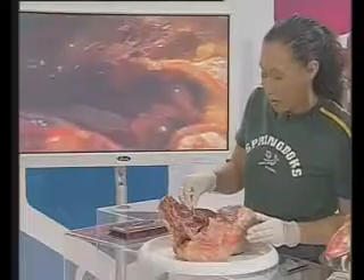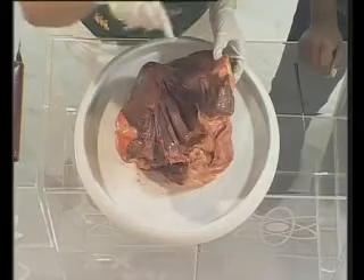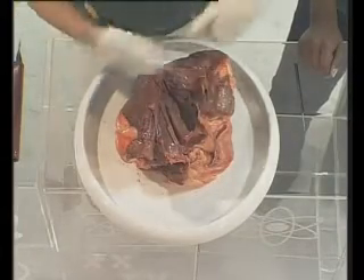You can see these sinews are pretty thick. So you can imagine your own heart — those valves are strong. An interesting fact about your valves is that they are the reason your heart makes a specific sound when it pumps. Your heart has a sound that goes lub and one that goes dup. The lub sound is actually your valves between your atria and your ventricles sealing and then opening up again. The dup sound is the valves running from the pulmonary artery and the aorta, basically opening and closing with the blood rushing back out into the rest of your body.